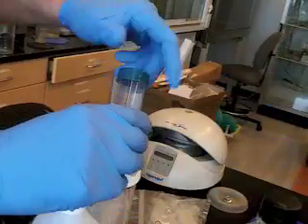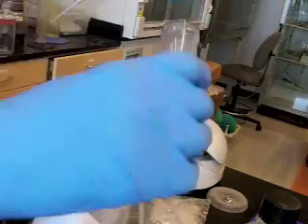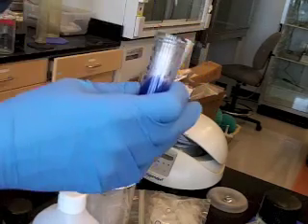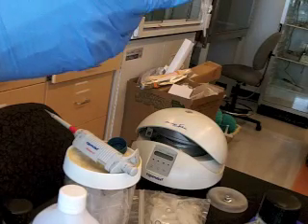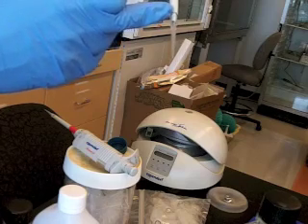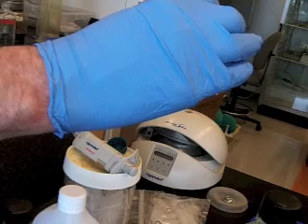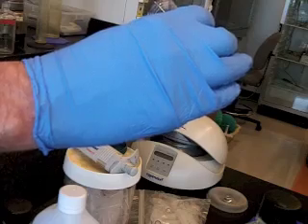Then another thing they'll do is they will often tip the container like this and tip it so the liquid is up near the top, so they don't have to push the shaft into the vial, tube, or bottle down to the point where this is in and could contaminate it. Again, you know, it's clean. We could try to clean it up, but nevertheless, it'd be considered dirty and the disposable tip clean. So scientists will often angle their pipetting like that, so that only the tip goes into the vial.